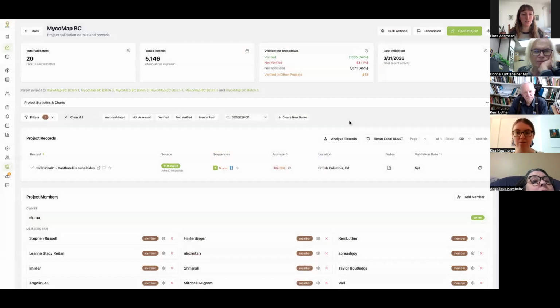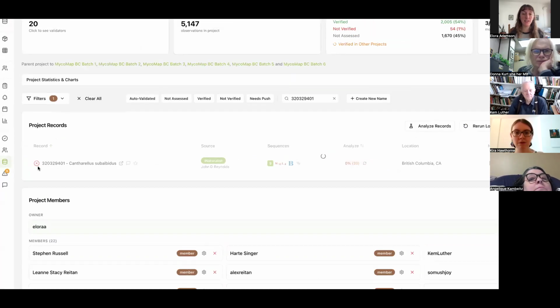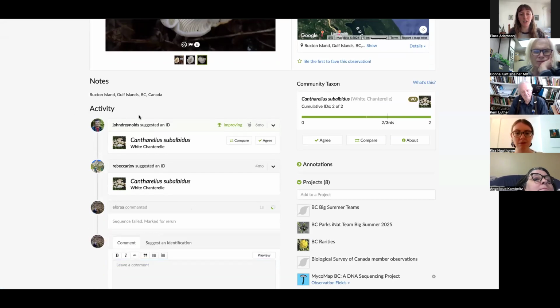So all we need to do in this case is press this to verify, but then press it again so that it turns into a red X. And that marks to Stephen that we want to have this rerun. We'll try one more time. And then the other thing that I do is I just go sequence failed, marked for a rerun. That way, like John's collected 2,000 things. He's not going to miss this sequence.